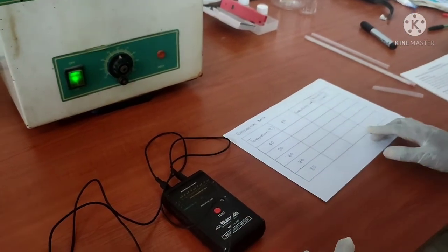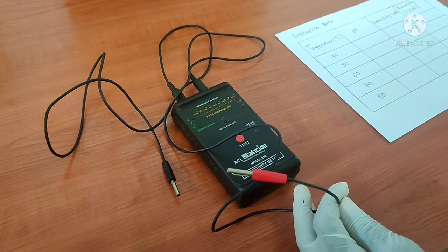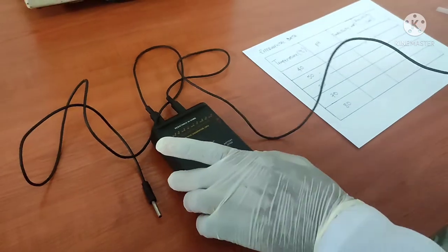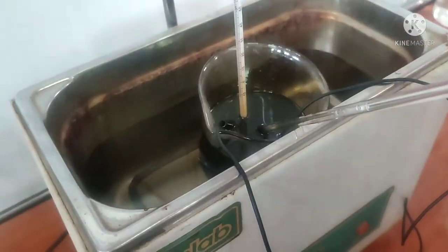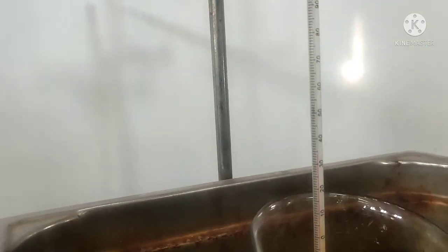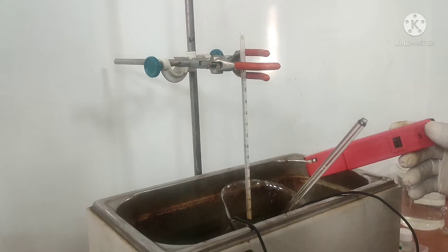As stated in the manual and also the table here, we are meant to take our pH reading and our conductivity reading first at 40 degrees centigrade. So we place the resistivity meter and the thermometer into the crude oil solution while heating it, allowing it to get to 40 degrees centigrade before we take our reading on the resistivity meter and also on the pH meter. Right now it's at 35, so we wait for it to get to 40.